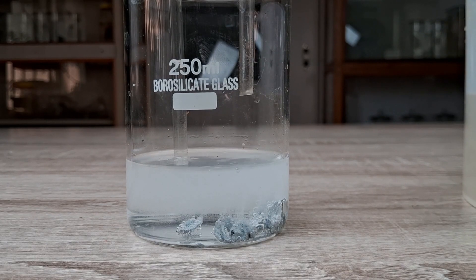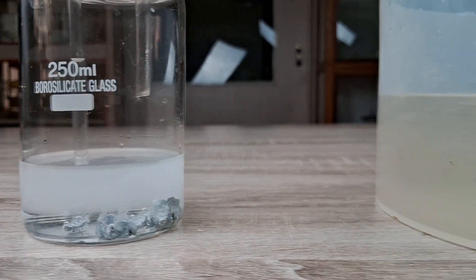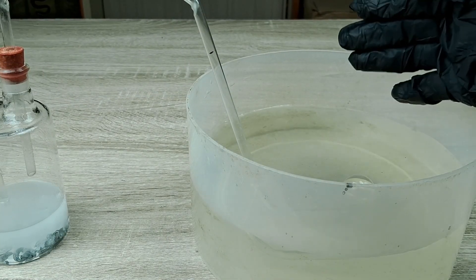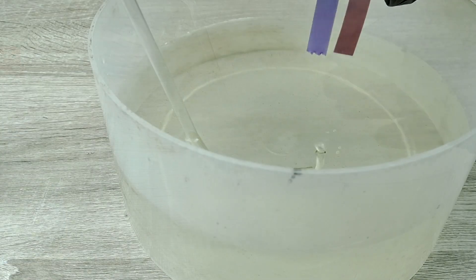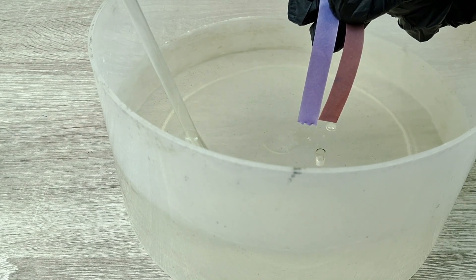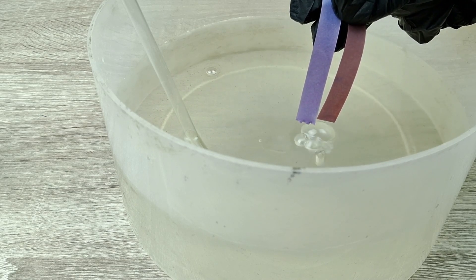Observe closely. The moment the acid comes in contact with the zinc granules, an effervescent reaction begins and bubbles of a gas are released from the surface of the zinc granules. The gas bubbles escape through the other end of the delivery tube submerged in the water. A slight whiff of the gas presents an odorless smell but is slightly irritating to the nose. If you bring a strip of moistened blue and red litmus papers near the gas bubbles, there is no change in color in either strip, showing that the gas is neutral in nature.